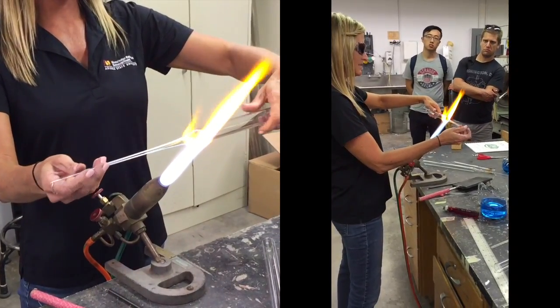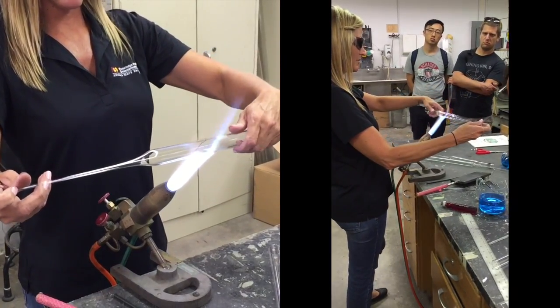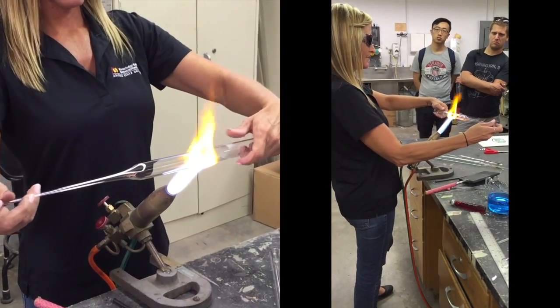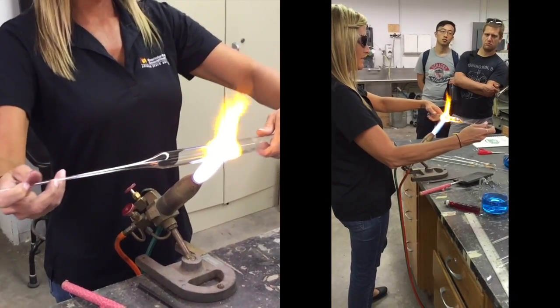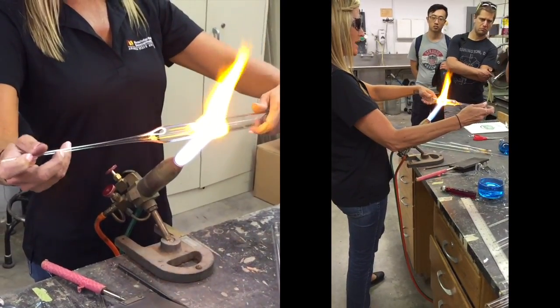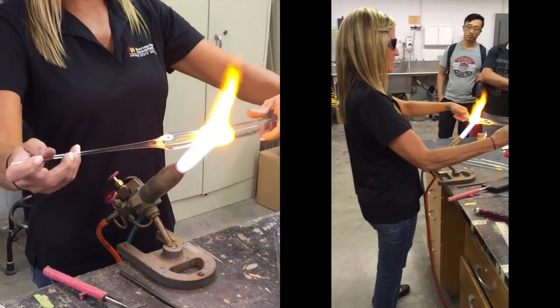Let's make this nice and straight. Rotate it on center, and then I'm going to pull another point over here. I'm just going to keep rotating — if I weren't rotating, this would just drop and drip off there like honey. It's a weird soft texture in there.